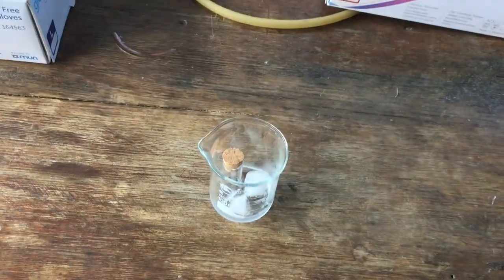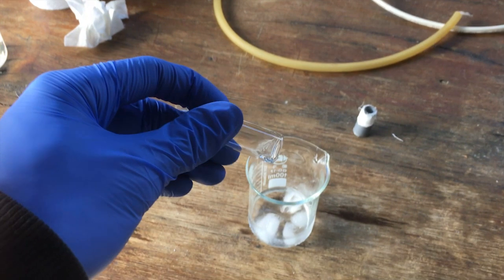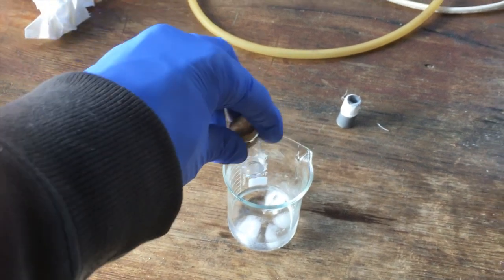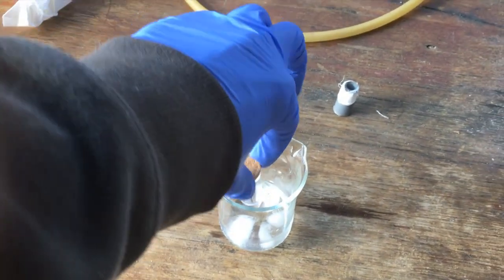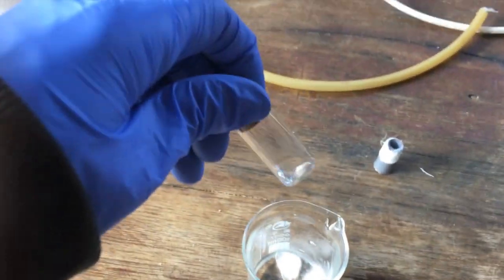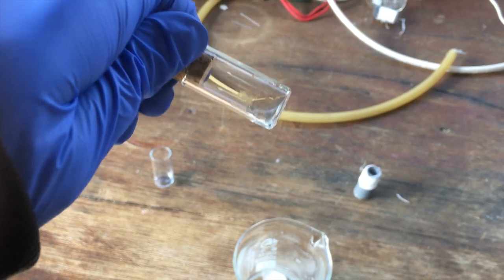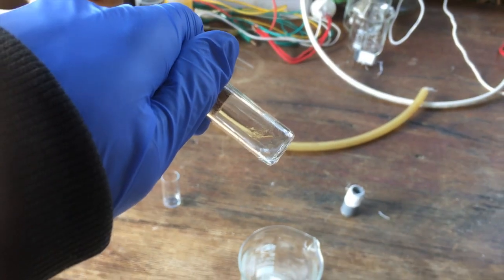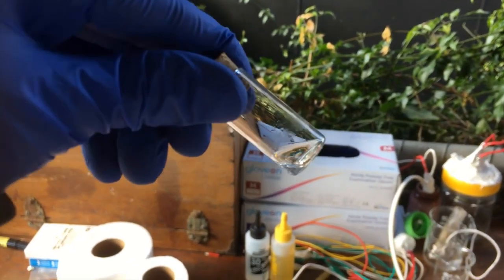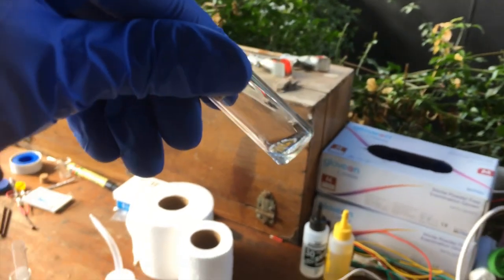So this is a pretty good determination of whether or not we do actually have any kind of high concentration of deuterium in water. All right, after multiple attempts at trying to freeze this water at 0 degrees, I haven't been able to do it. Whether I freeze it first and try to keep it as a solid, or if I just stick it in ice cold water like that, it has not solidified properly. So we don't actually have a high enough concentration of deuterium in this water to actually measure, I'm afraid. I guess there could be a tiny little bit of electrolyte in there that's preventing it from freezing, but I just think that we don't actually have highly concentrated heavy water at all.